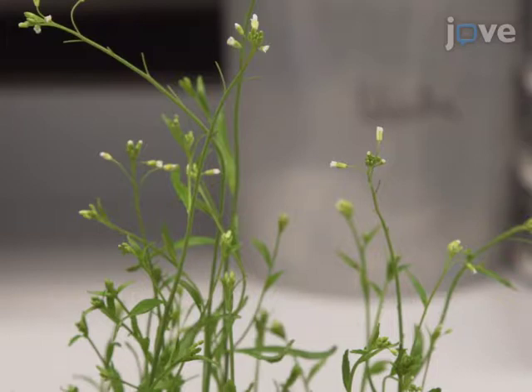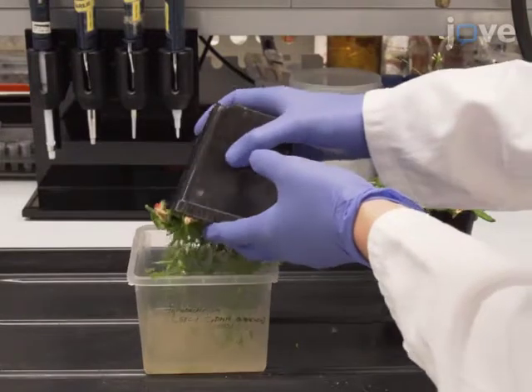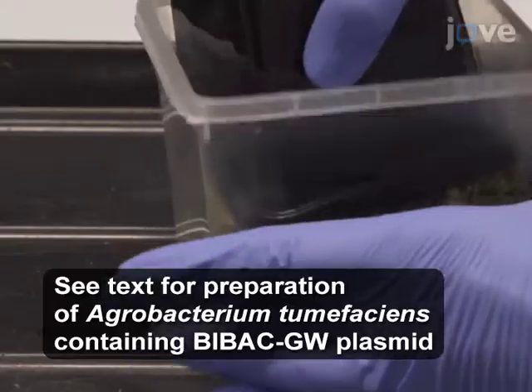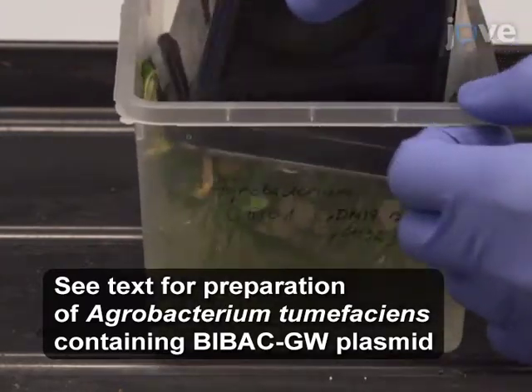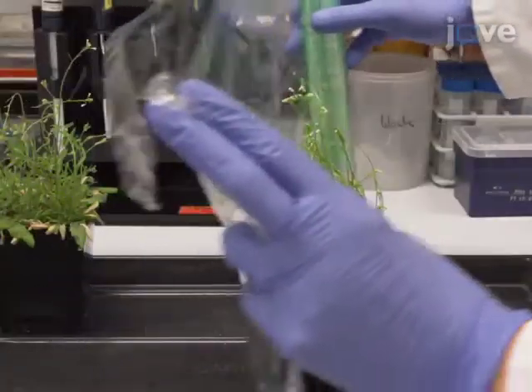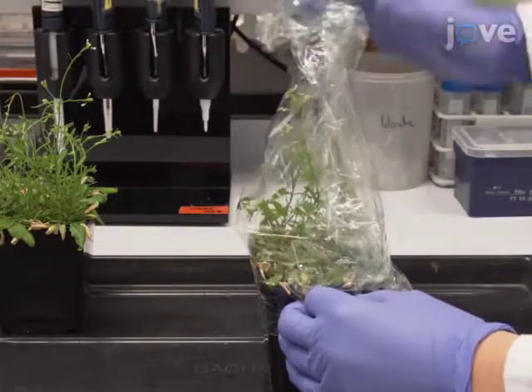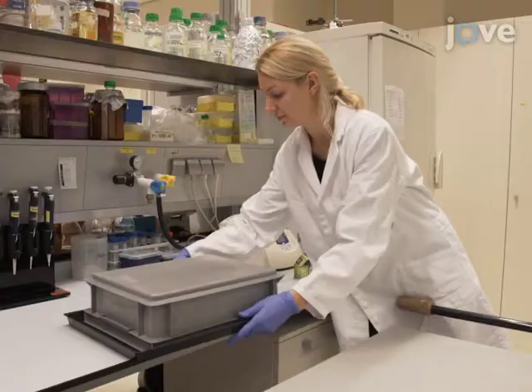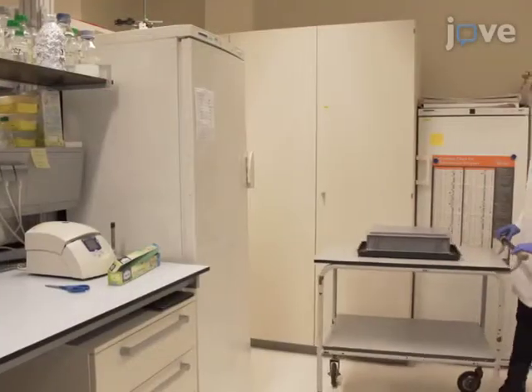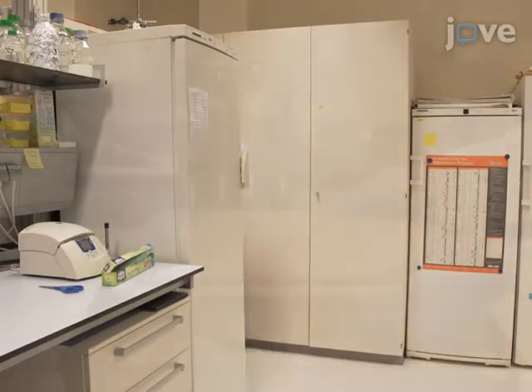To perform floral dipping, dip inflorescences for 5 to 10 seconds in agrobacterium suspension. Use gentle agitation. Wrap the above-ground parts of the plants in cling film to keep the humidity high, and cover the plant pots with a box to keep the plants in the dark. Incubate the plants for 2 days in a greenhouse or growth chamber.